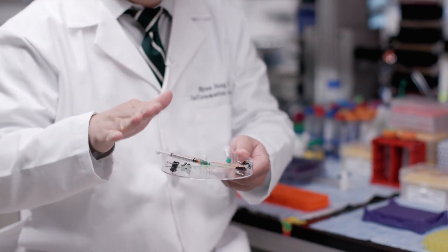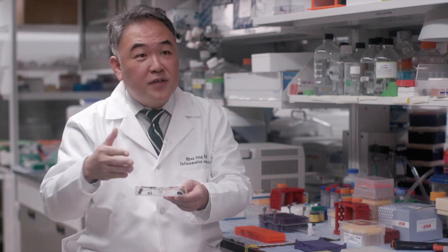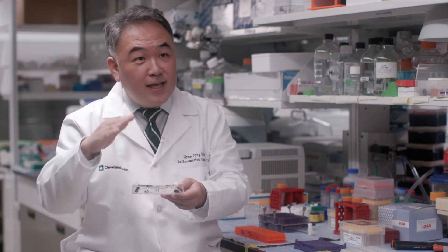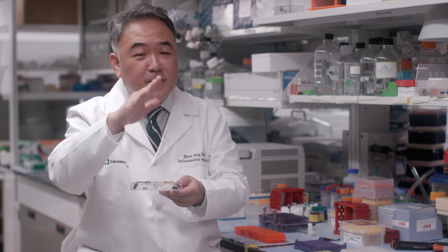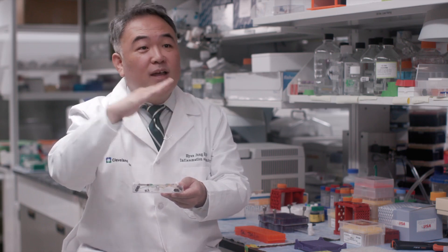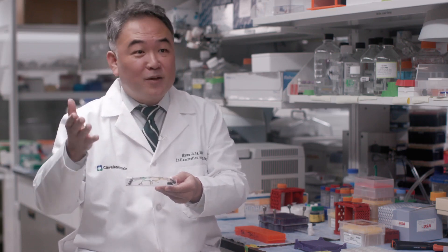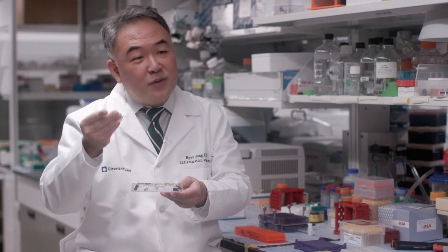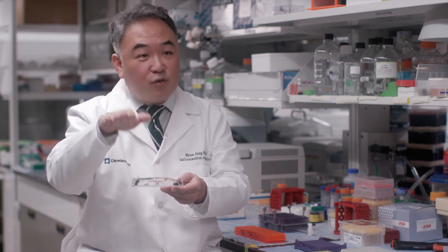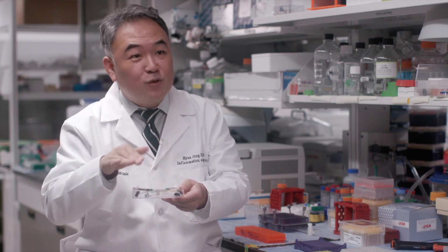This channel and their interface are actually making the interface of our intestinal tissues. We are trying to make the tissue interface that reflects what's inside the gut and inside the vasculature, by growing epithelial cells, endothelial cells, and different types of cells that are directionally introduced into the channel.